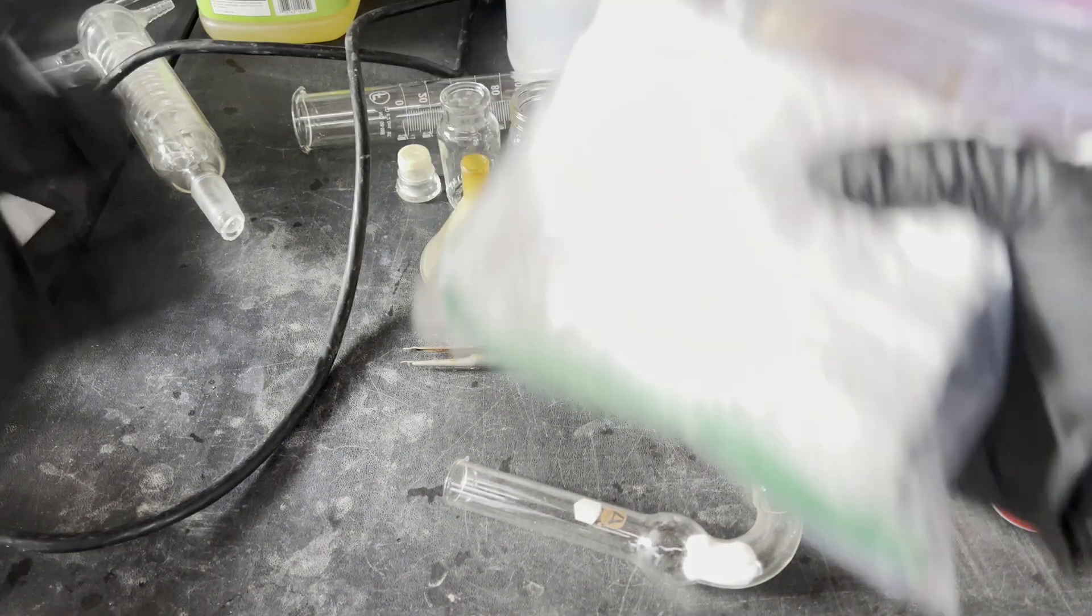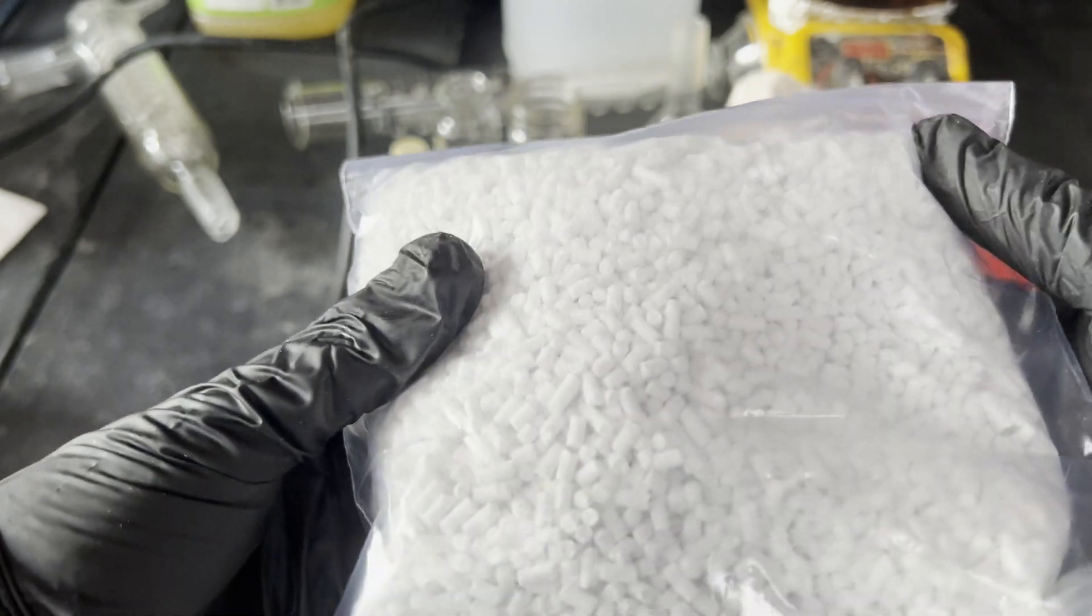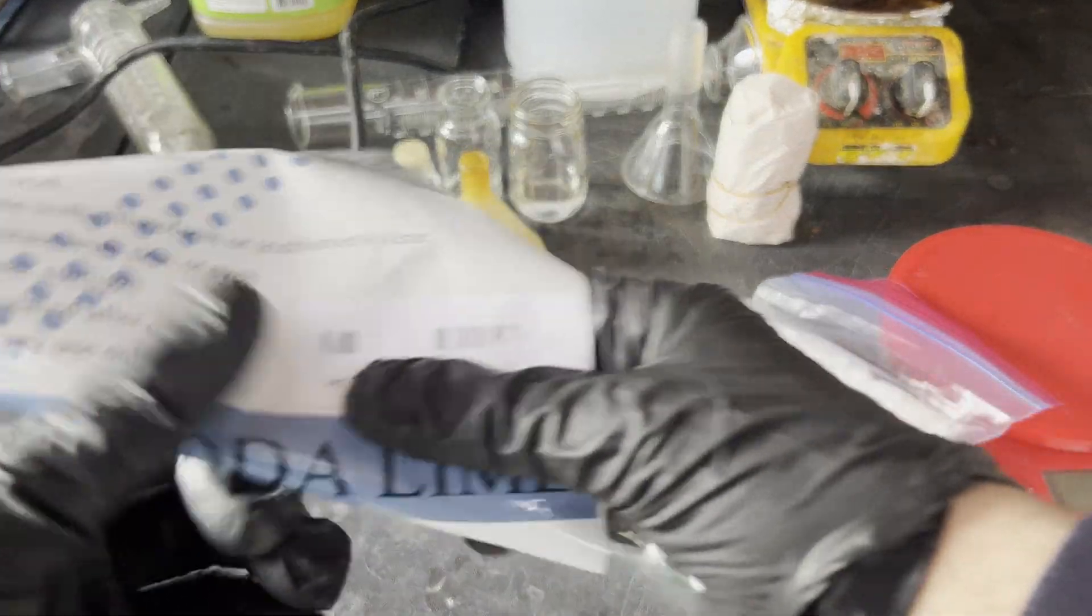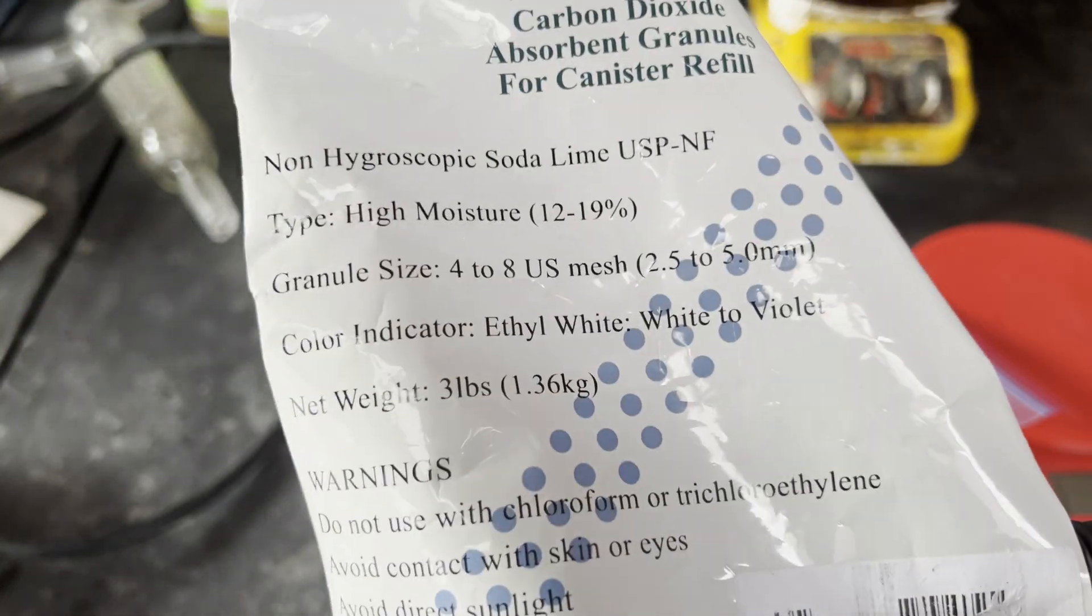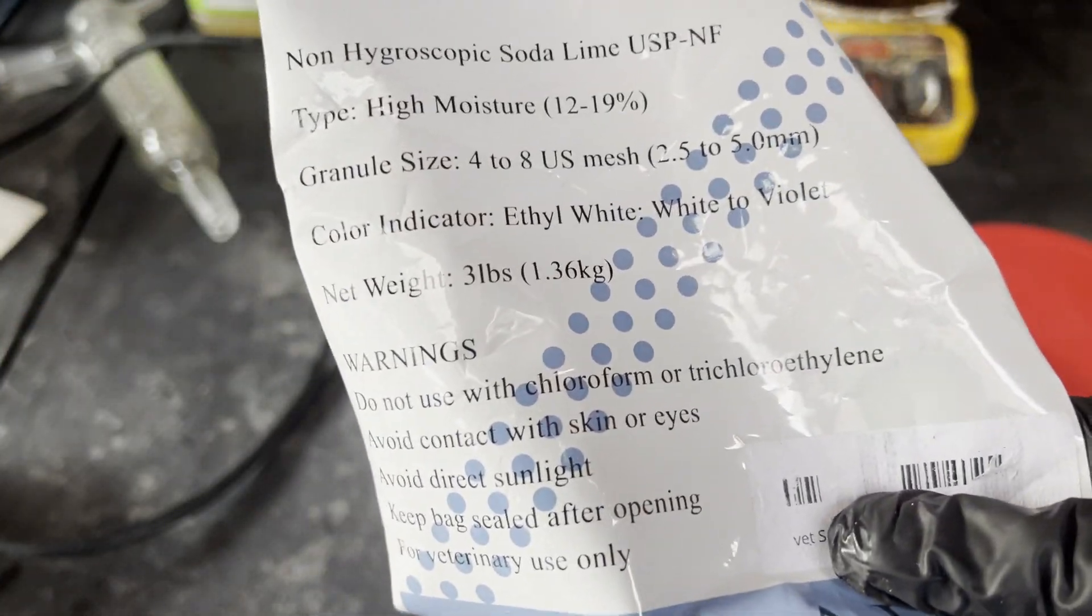Firstly, I'm packing a drying tube with a mixture of sodalime and anhydrous calcium chloride to protect the mixture from water and CO2, as sodium methoxide is very sensitive to both of them.